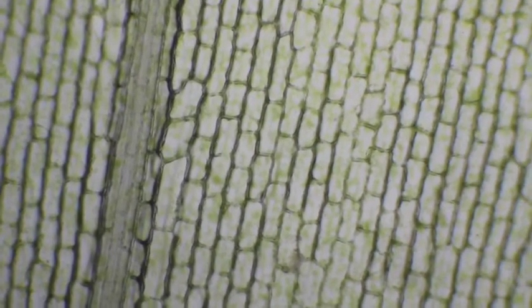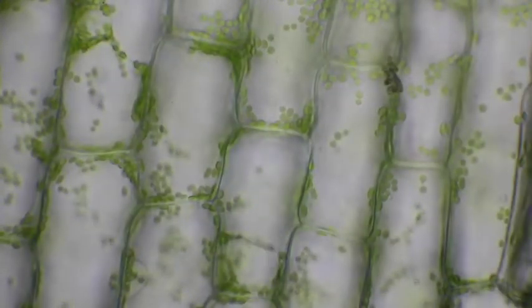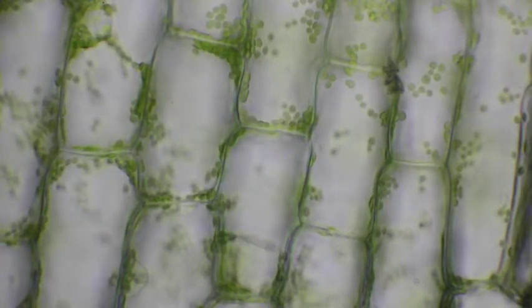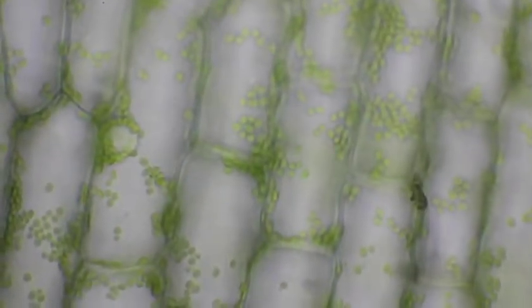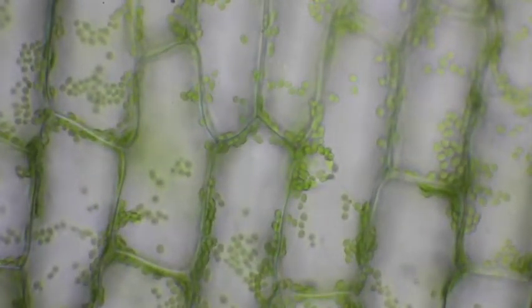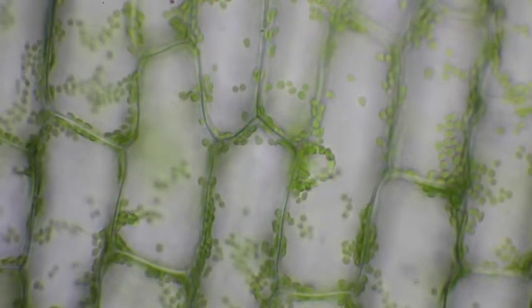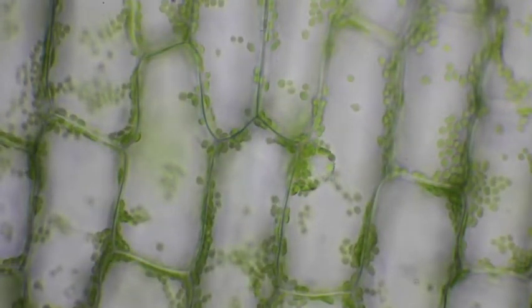We can't see a lot in here because this is brightfield microscopy, and brightfield microscopy washes out a lot of stuff — small transparent things. The light has to hit it just right to be able to visualize them. Right there we can see that nucleus in the center of that cell, but if the light hits it wrong, then we won't be able to get a good view of that nucleus.